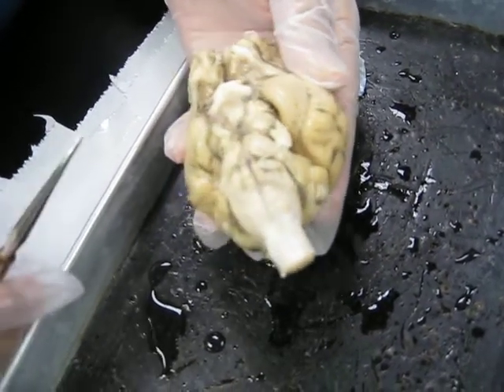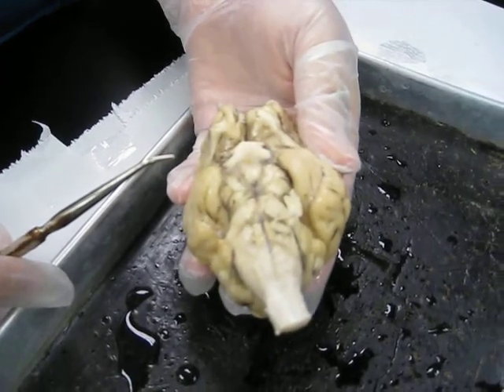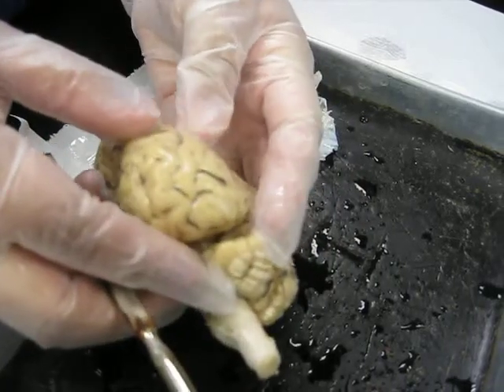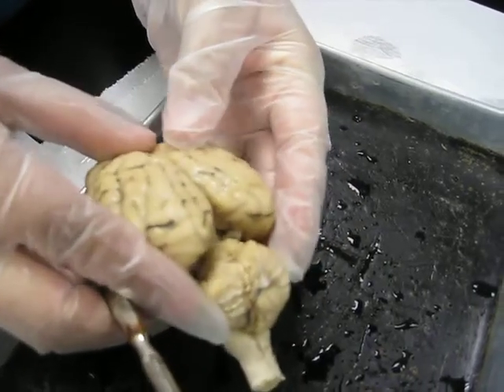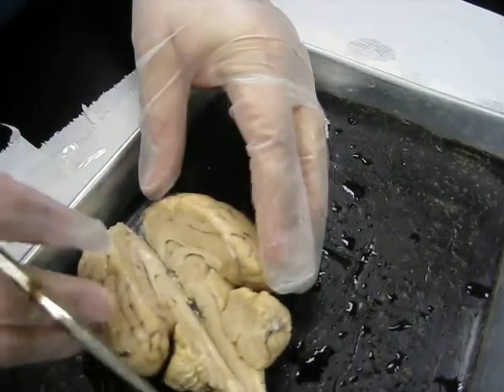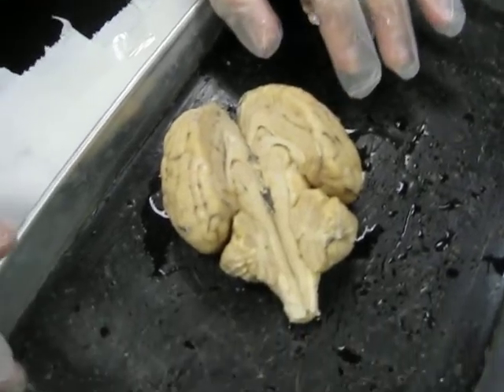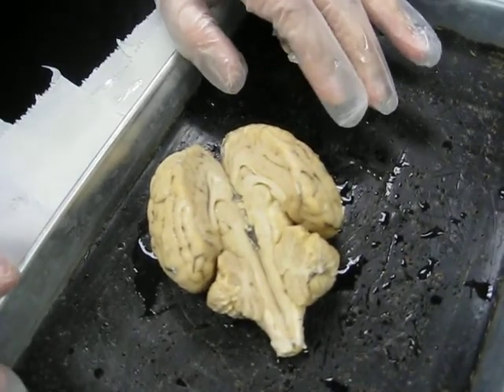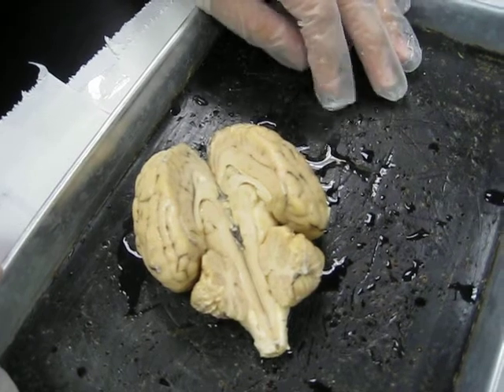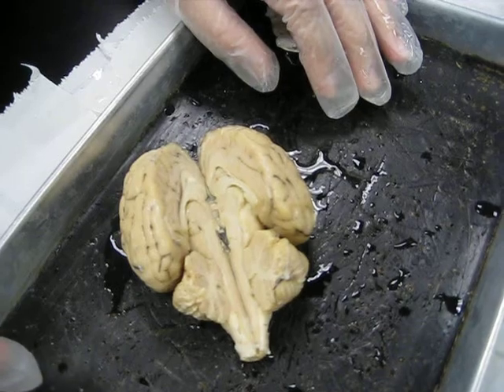Okay, having located those external structures, we're now going to look at the internal structures. We're going to take a sagittal section, so you're going to cut your sheep's brains right down through the great longitudinal fissure. You're going to continue your incision right through the cerebellum and down through the spinal cord so that we fold the brain open into two halves. When you make this cut, you want to do it with a minimum amount of back and forth sawing that you can possibly do. Try to make the cut just a nice, sharp, smooth cut, one single cut if you possibly can. I've got a brain here that we have already open, and we'll take a look at the insides of this.